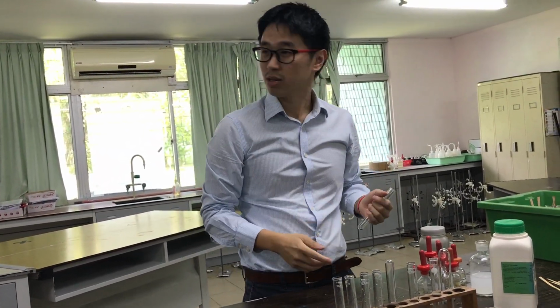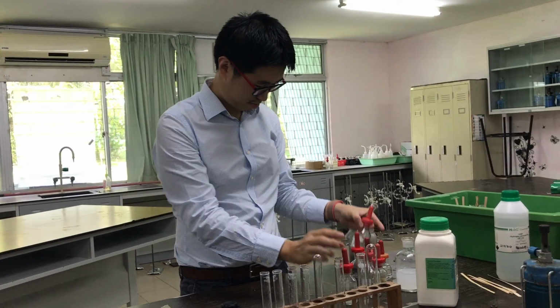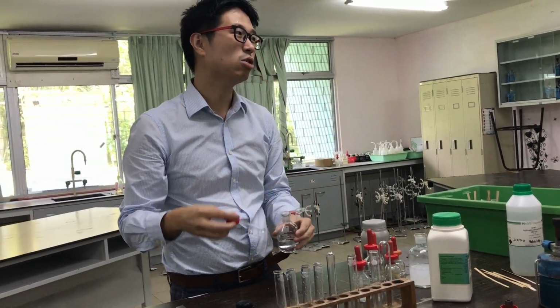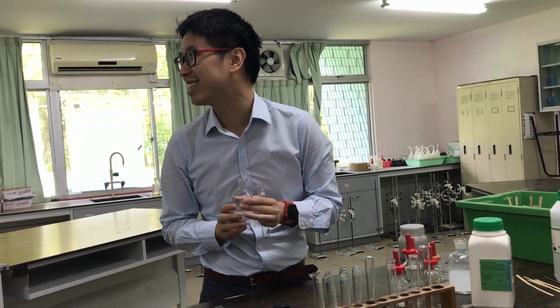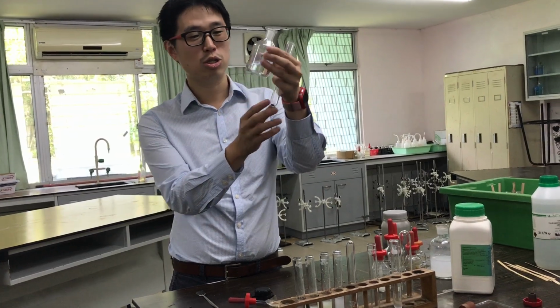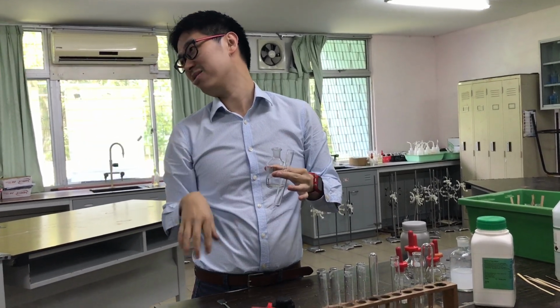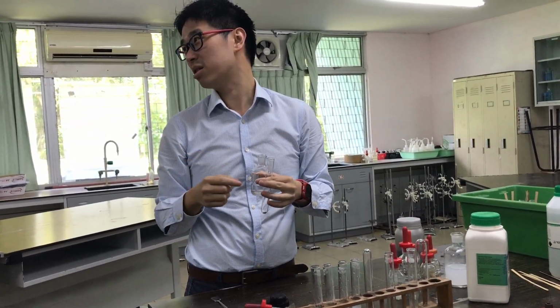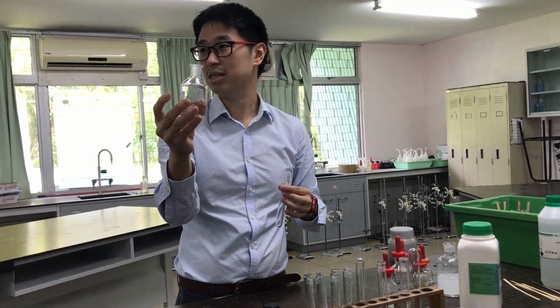What acid do you want to use? Give me one acid. Let's try hydrochloric, okay. Magnesium metal plus hydrochloric acid. So you get a metal salt and you get hydrogen gas. What's the name of the metal salt? Magnesium chloride is correct because the acid used is hydrochloric acid.